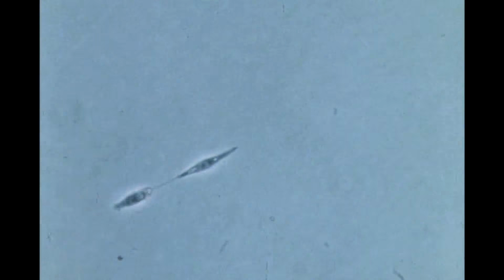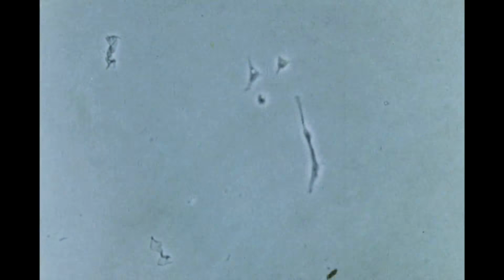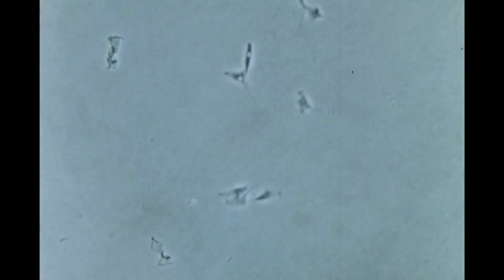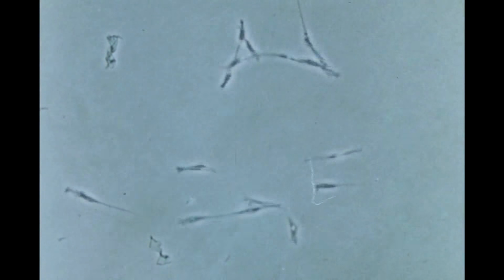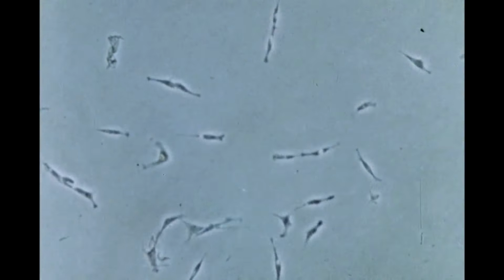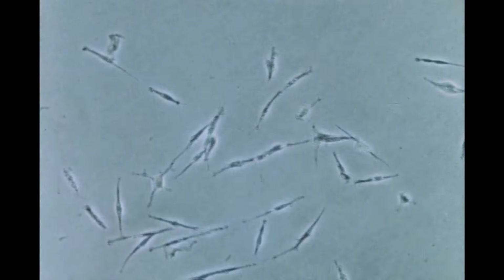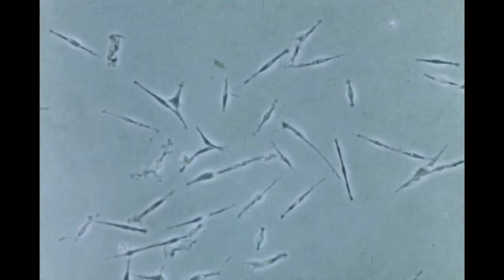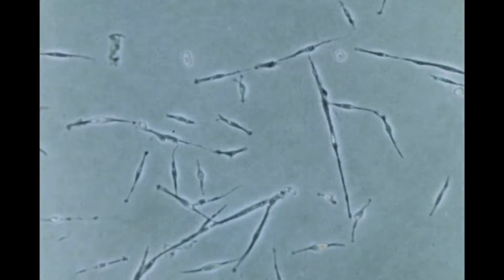Two daughter cells are in the process of separating after the first mitotic division. The myoblasts continue to divide. Eventually, cell division becomes less frequent and the cells begin to align themselves in strands. Cells often break formation, however, and wander away.